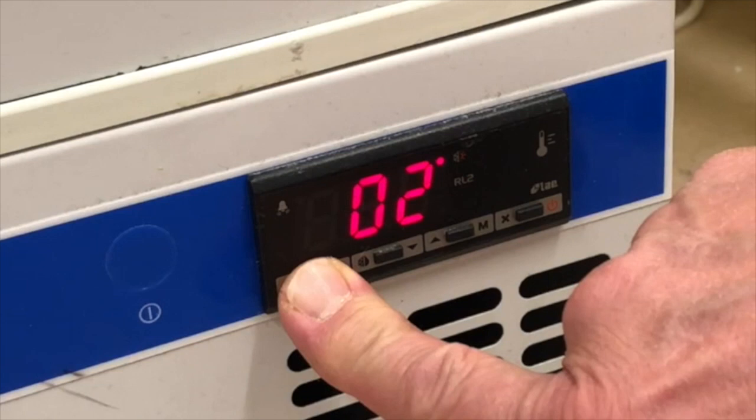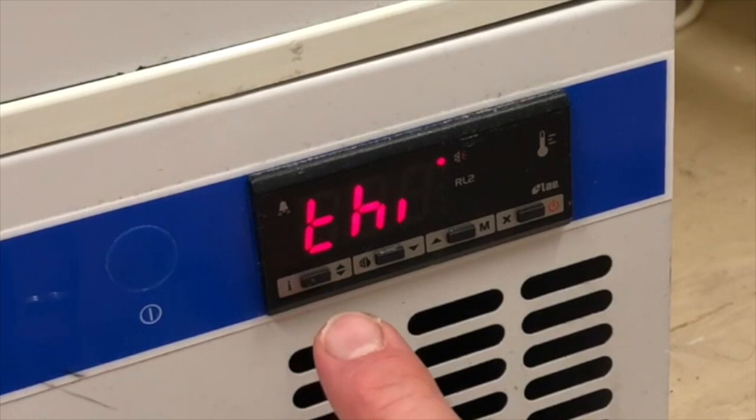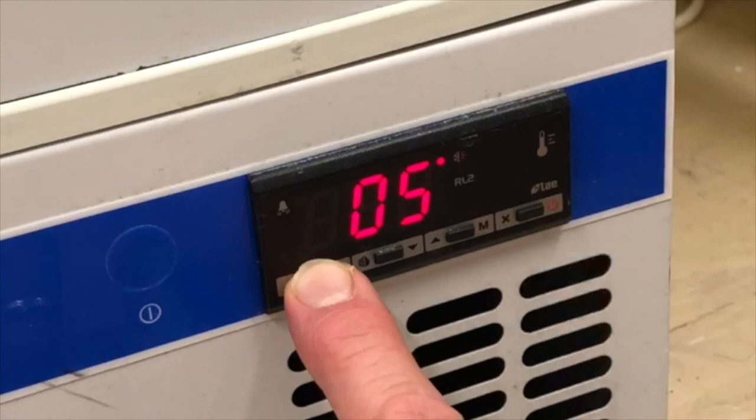To reset the temperatures, press the I button. Then press and hold the I again and press the X button too. Release both buttons, then press the I button and press the X button too. You've now reset the maximum and minimum recorded temperatures.